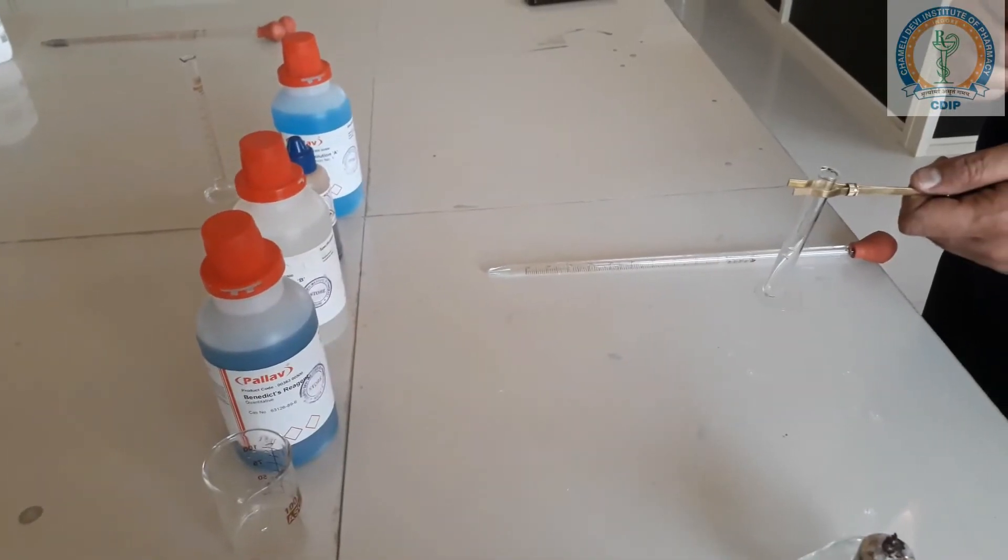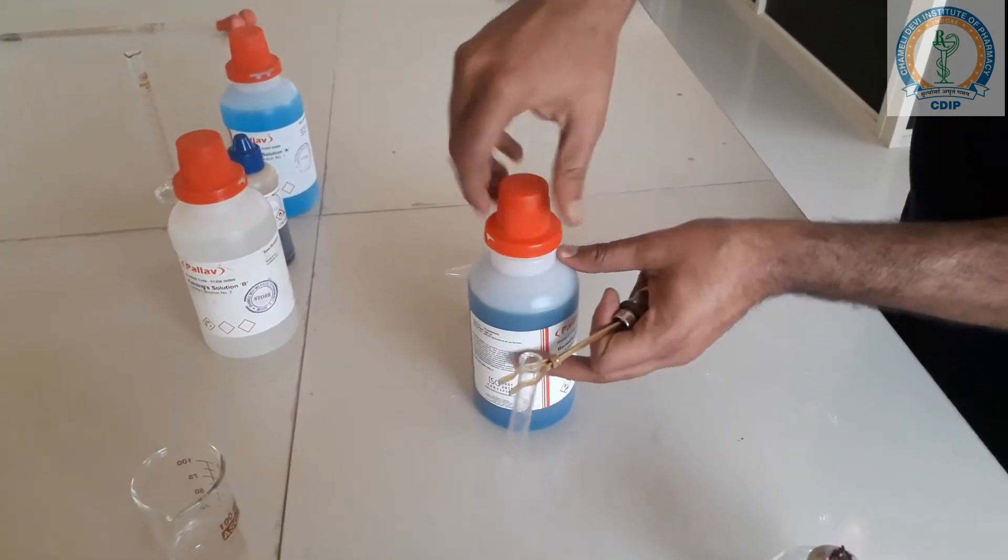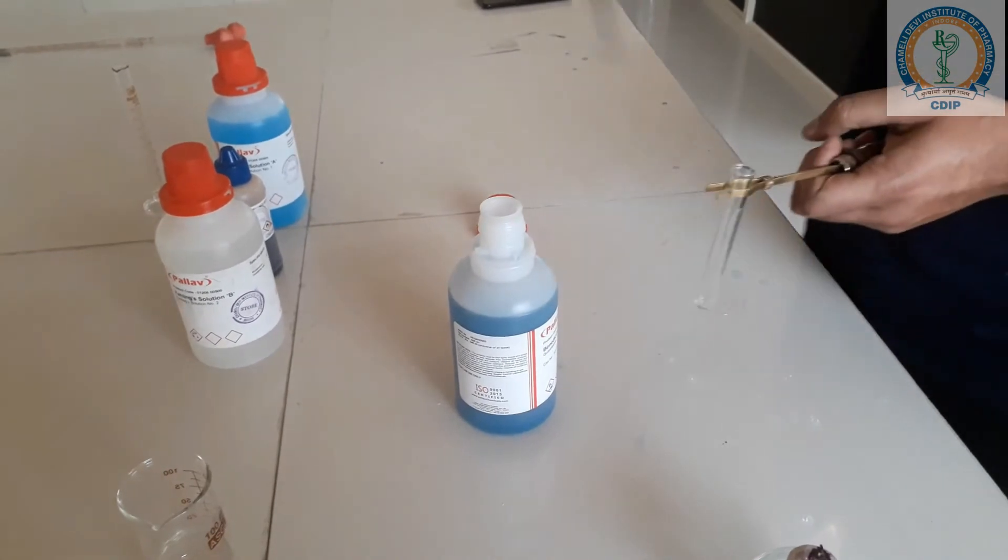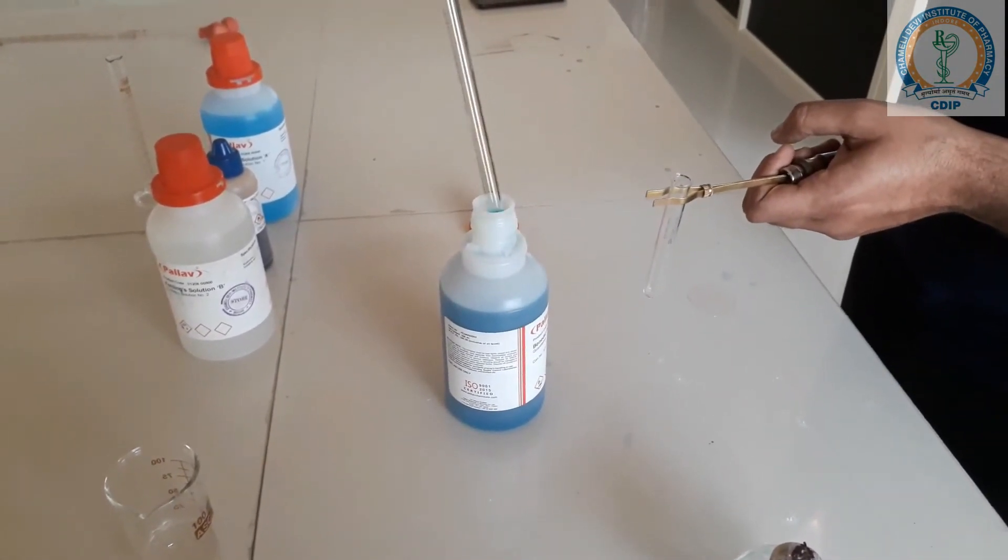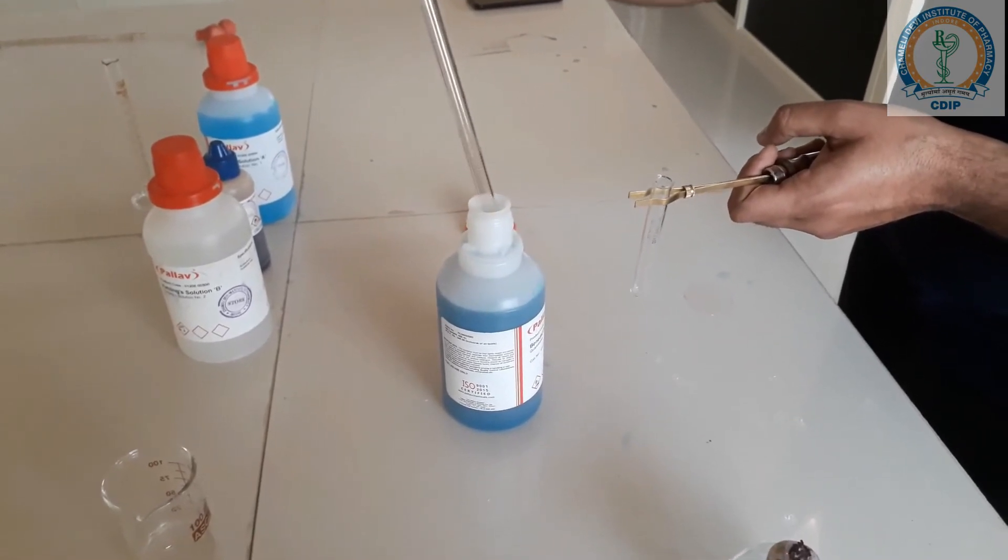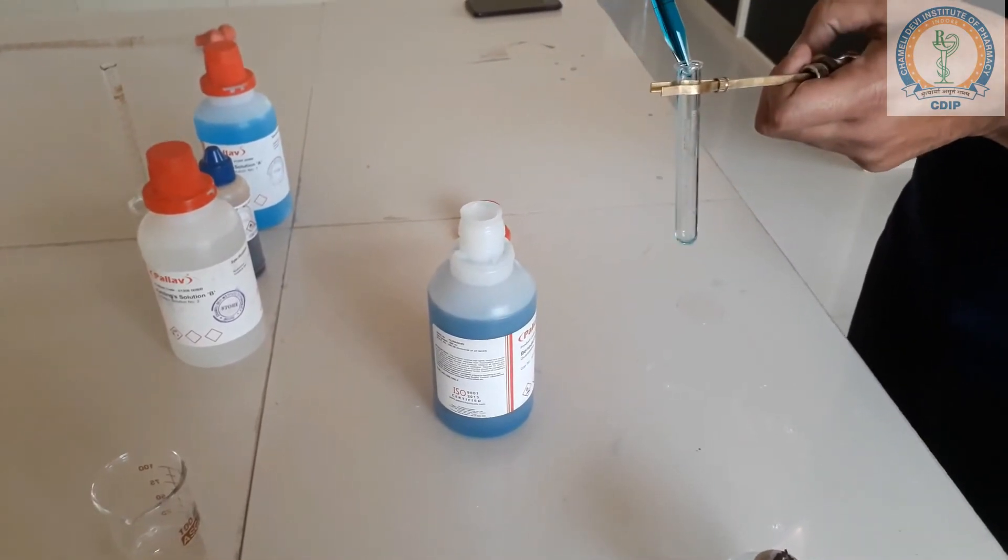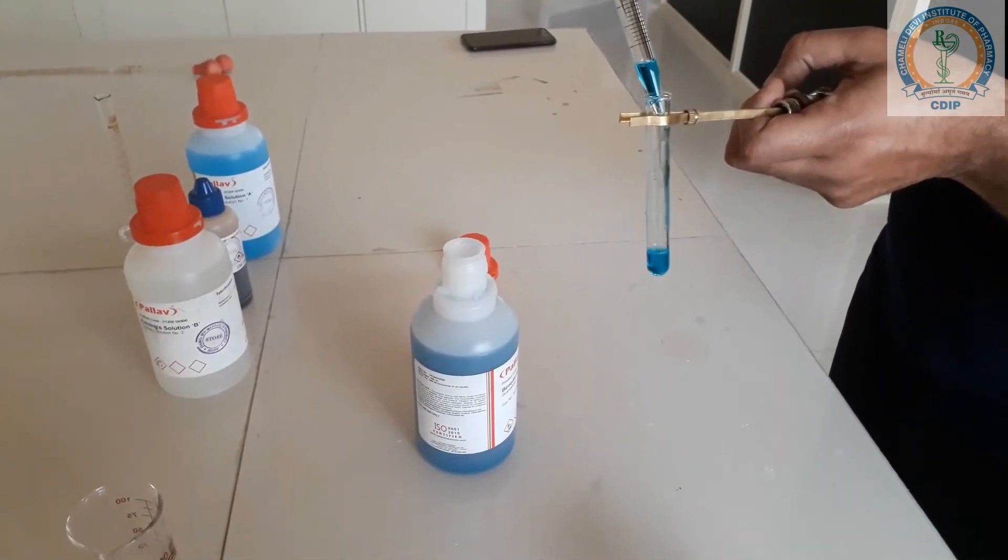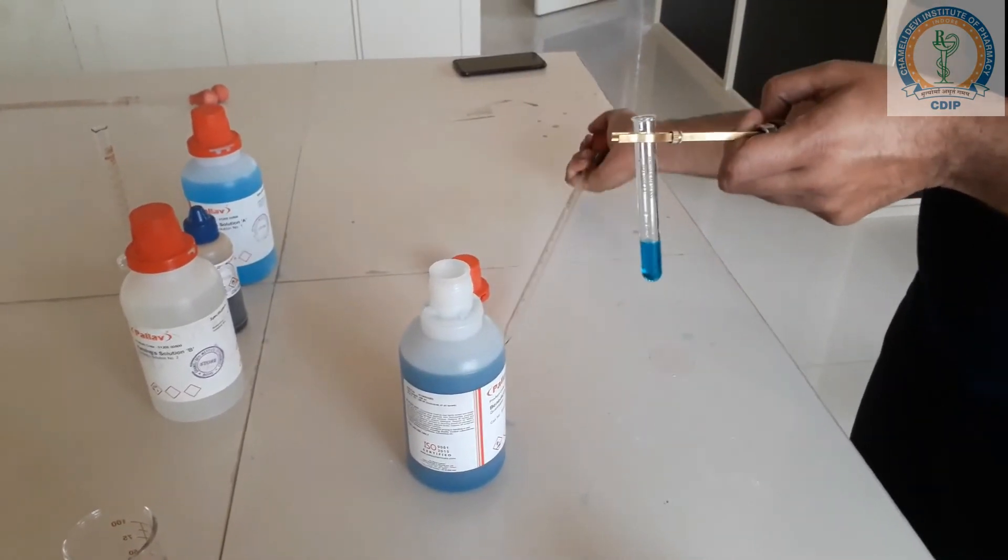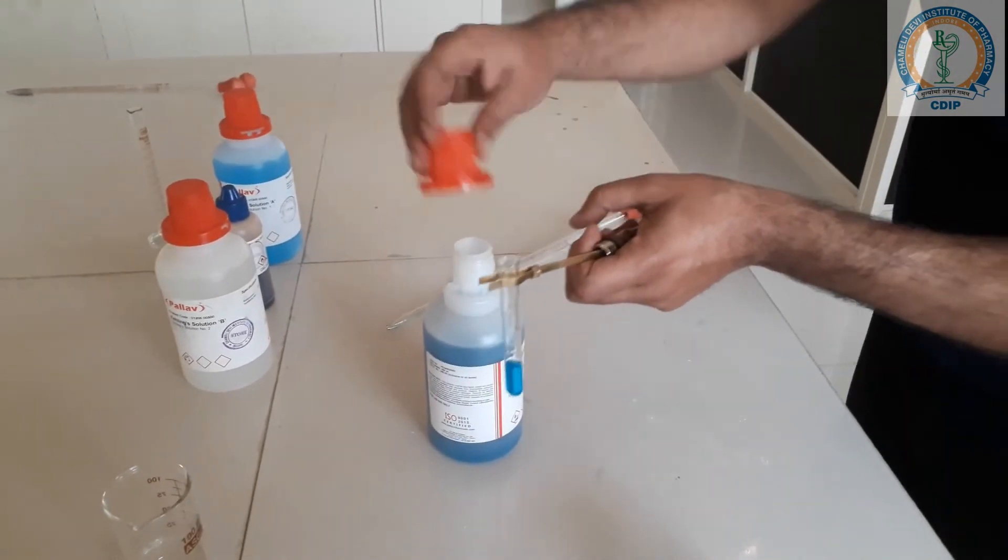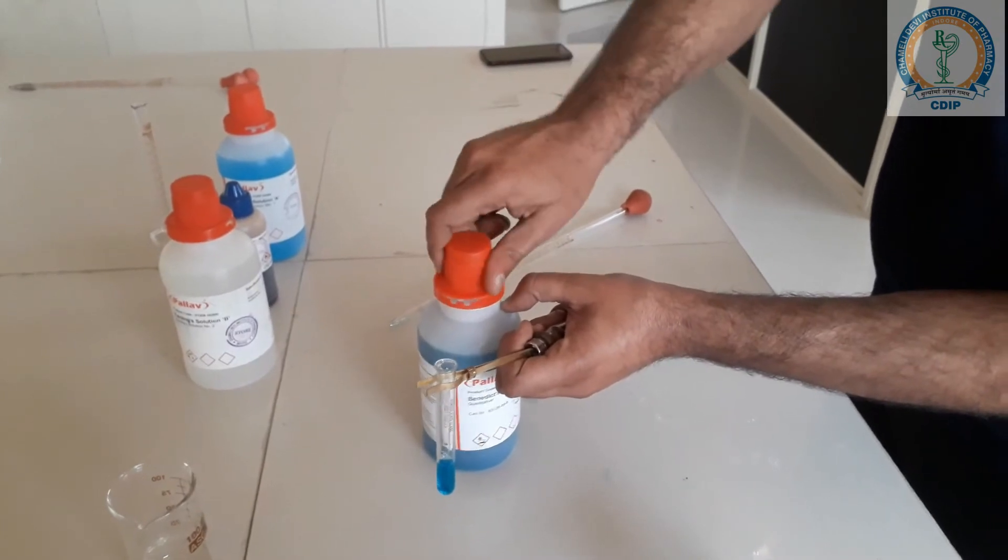For this test, we require 2 ml of Benedict reagent and add 3 to 4 drops of test solution.